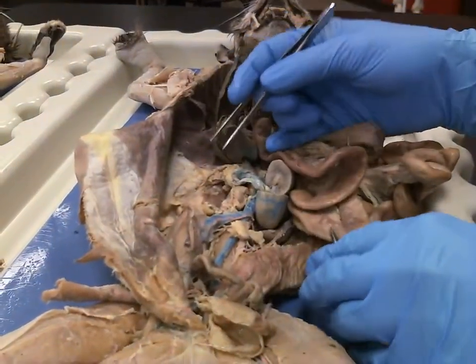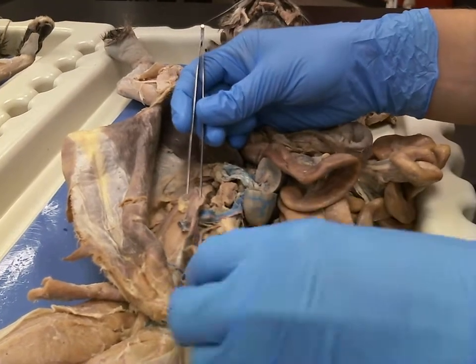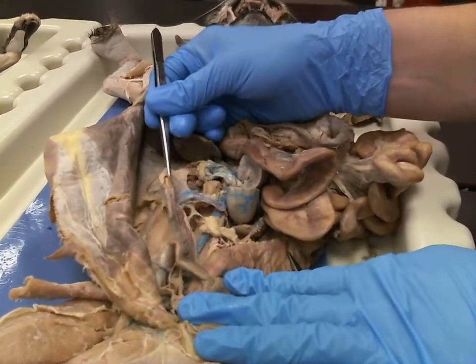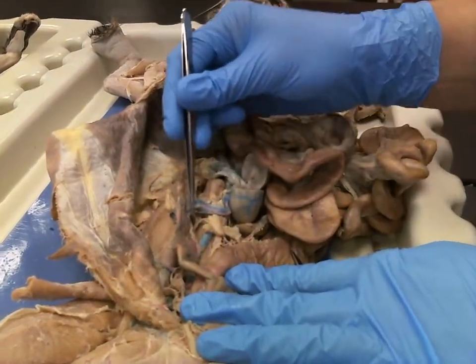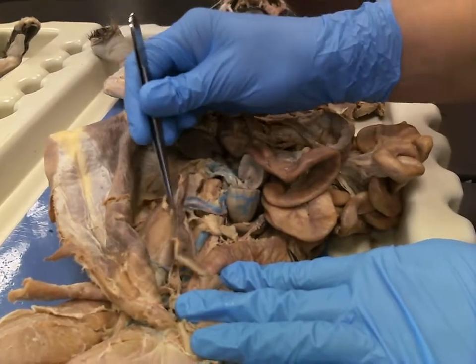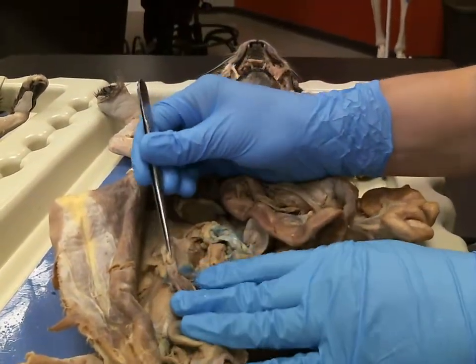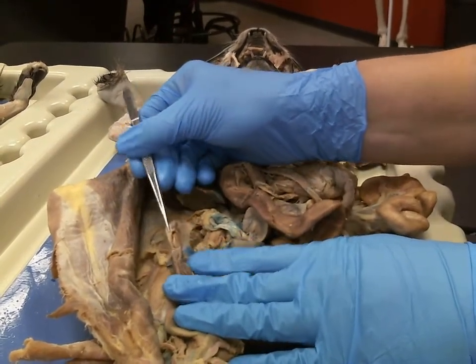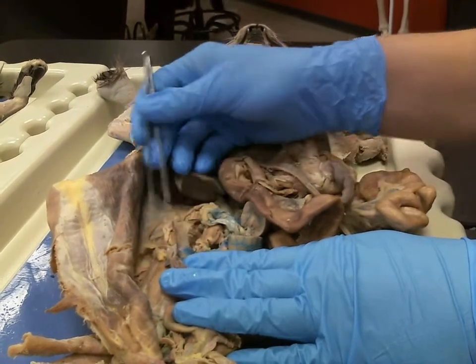Alrighty guys, welcome to the reproductive tract. Here we're going to do the female reproductive tract. So as you look at this orientation right here, you can see that the cat has two uterine horns right there. This uterine horn comes up to an ovary. The little ovary is right here. Next to the ovary is the fallopian tube or the oviduct right there.